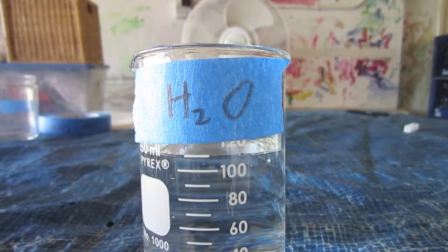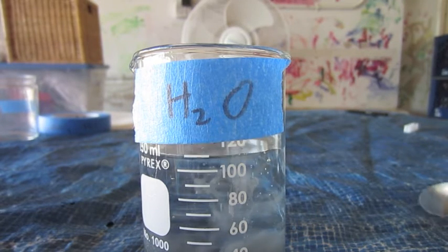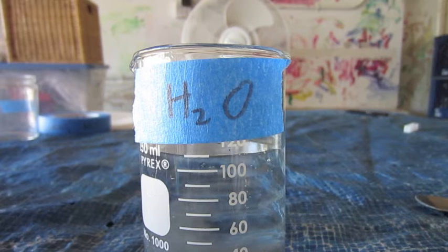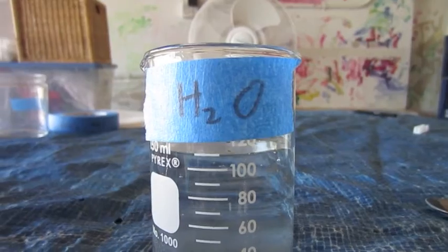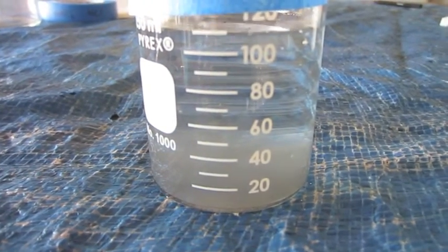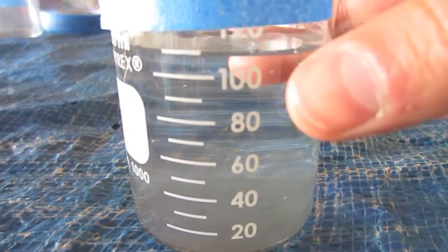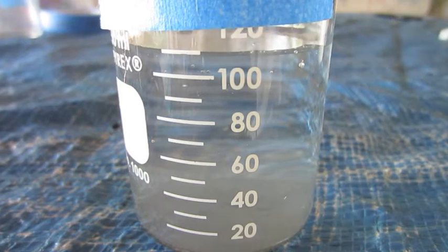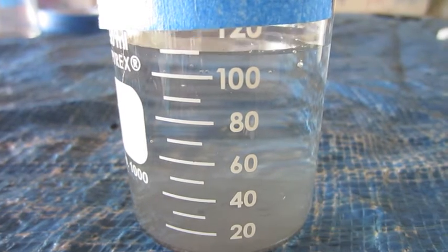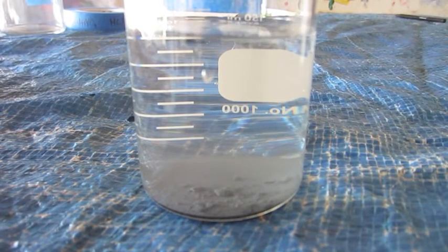Now that sodium is down and out of the competition, we're on to zinc. And this, I put some zinc in water, which is the same thing I did with the sodium. And you can see some bubbles, but those are just bubbles from the very beginning when I dumped it in. They don't continue, as you will see. So zinc is still in the competition because it will not react with water. And just to show you, this is a clip about a minute later. The bubbles have stopped.